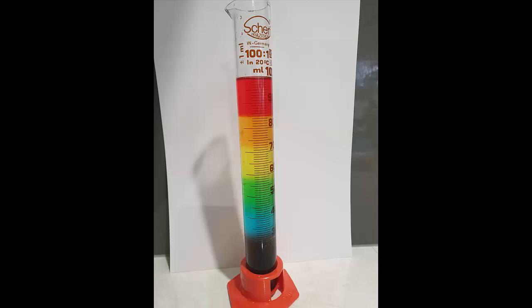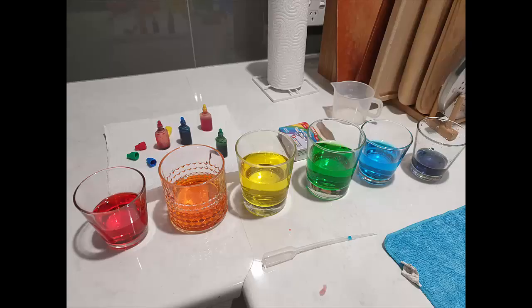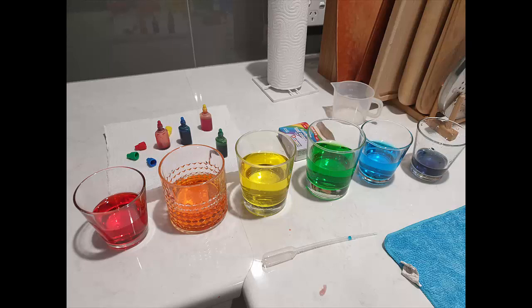We're trying to get you to do this multicolored layer thing, which is really quite difficult. I'm going to tell you how to do it because in decades of doing this with students, they don't do it as well as this one here. First of all, I got all the colors I wanted so they'd look right — orange is yellow and red, green is blue and yellow, and purple is blue and red. Once I was happy with the colors, I turned the purple one into the thickest slurry I could.